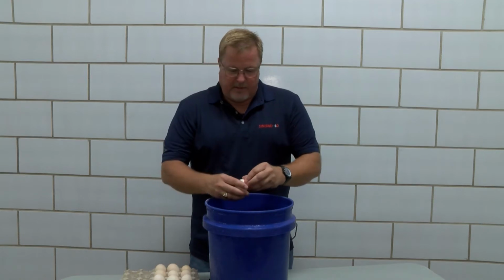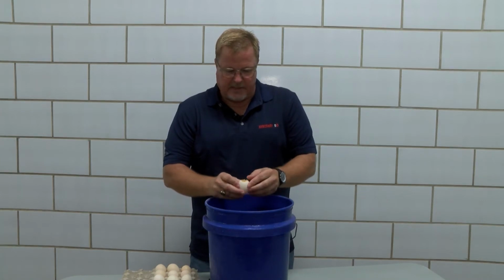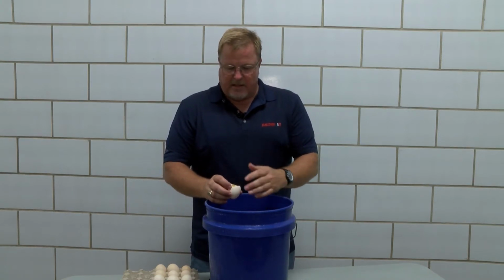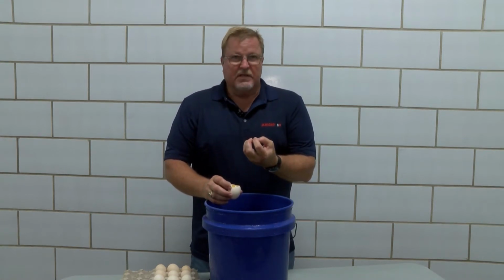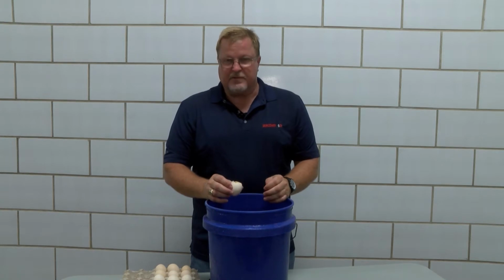So we can take these eggs from the flat, gently take the top off. And again, this is for training purposes, so we'll get a little bit slower here. But what we want to do, if we can, is take the shell off so we can see the contents of that yolk and that germinal disc. Often that germinal disc will be raised to the top of the yolk material, so we should be able to see it there. We look for any signs of development. This is where we'll determine if it's fertile or infertile.